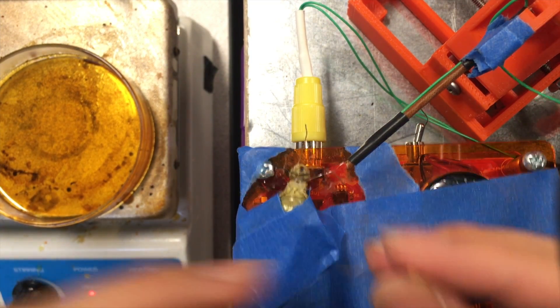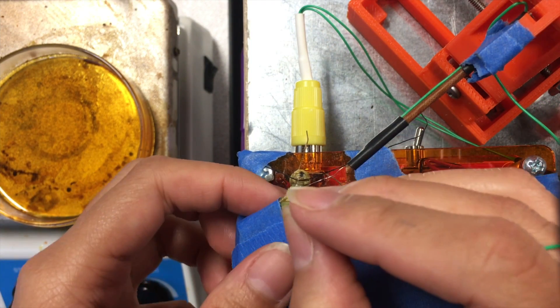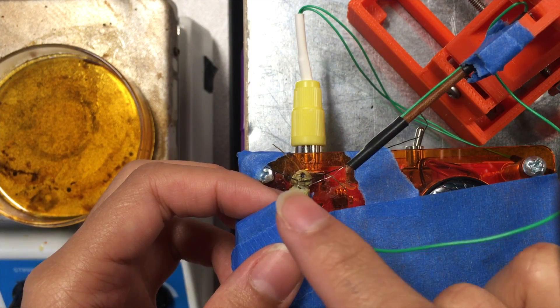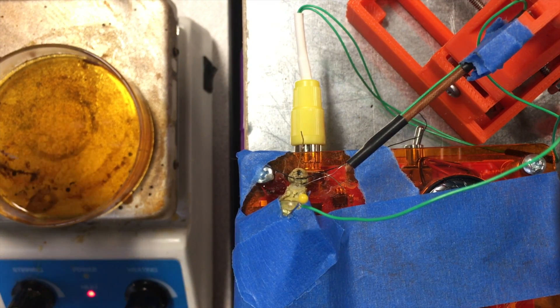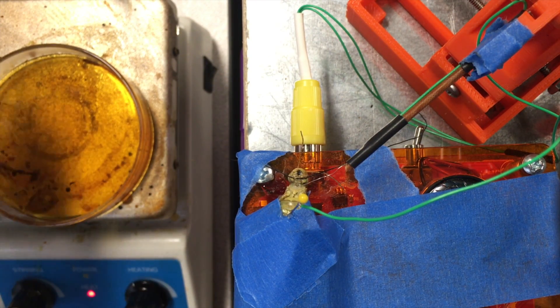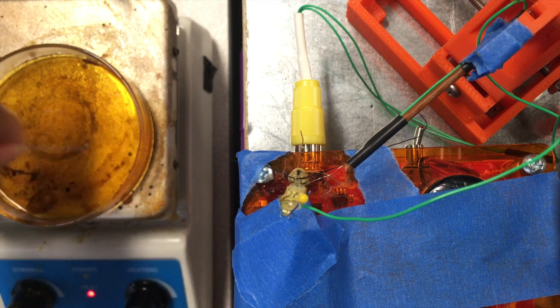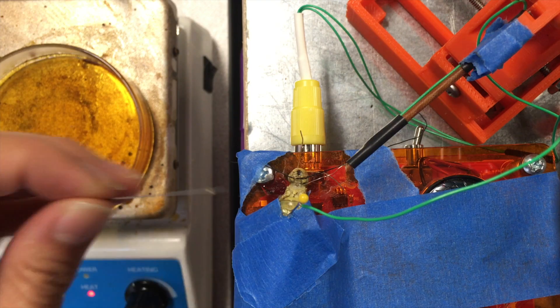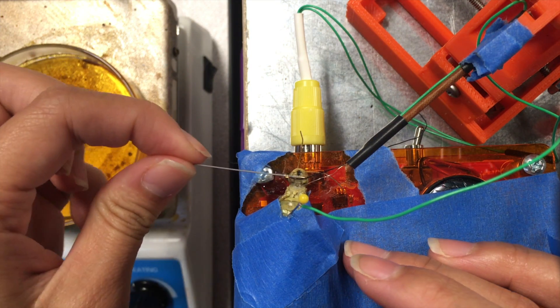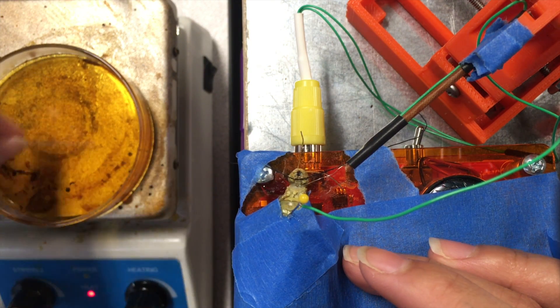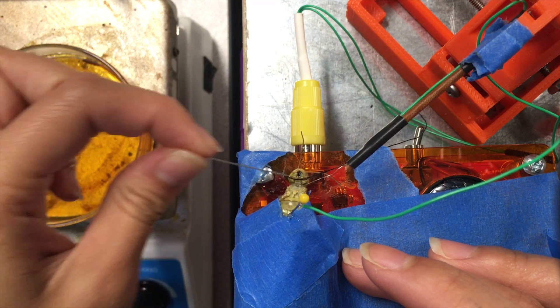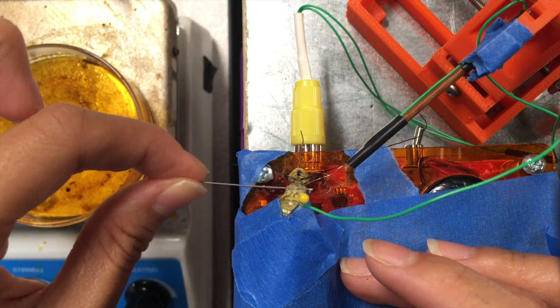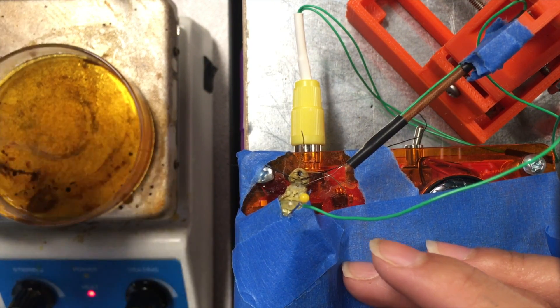Then the reference electrode is grounded in the thorax. I also have a mixture of wax and rosin here on a magnetic stirrer that melted them together. This I'm going to place on the thread so that it keeps that thread holding back the neck of the grasshopper secure and in place for the experiment. Otherwise, it's going to move and we'll get muscle activities in our recordings.